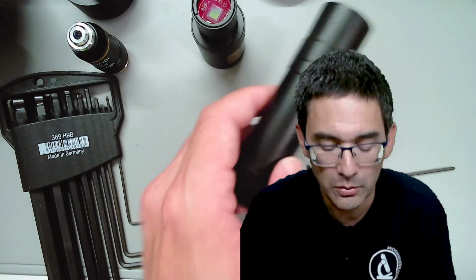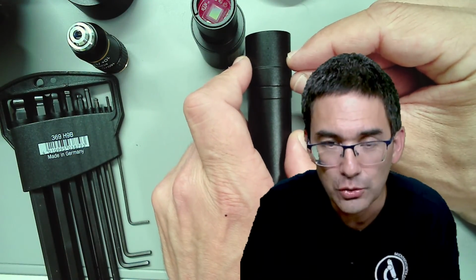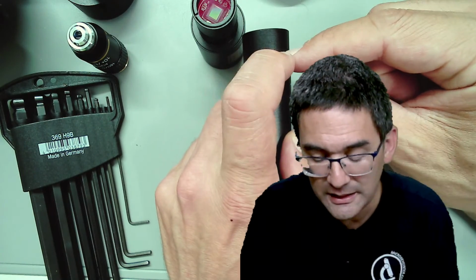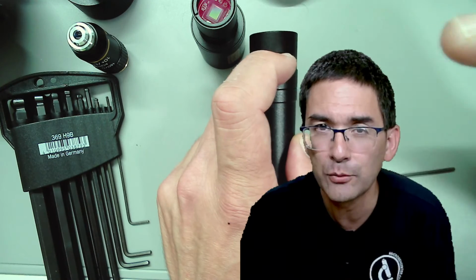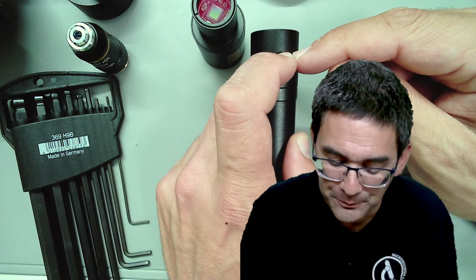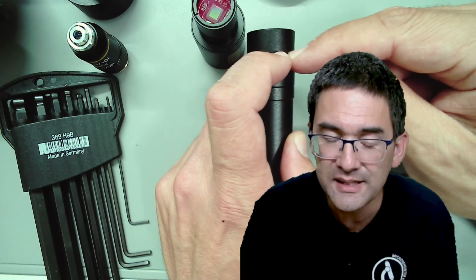However, you can measure it out. You know over here that the image is created 1 centimeter down into the tube. That's also standardized, and then there are camera specifications that you can find online, basically that this is the place where the sensor has to be.